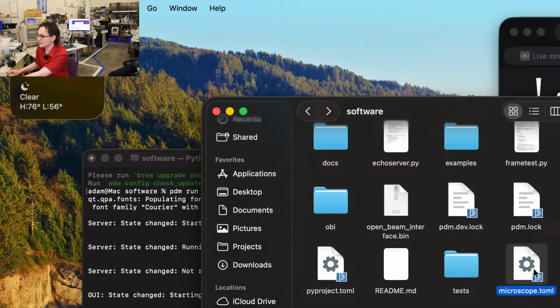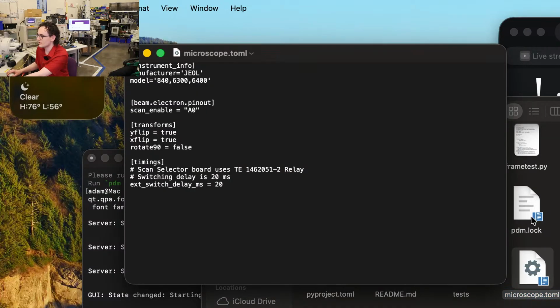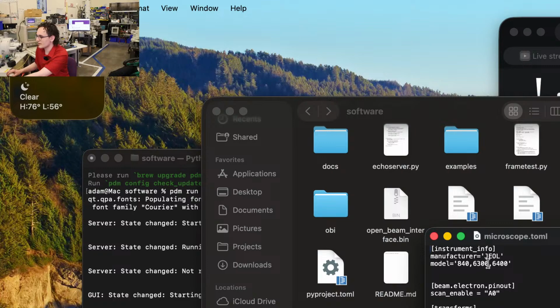And so I'll just go ahead and show you what's in our toml here. We just want to do text edit for now. So this is pretty simple. We tell it what pin we want to use for our external scan enable. In this case, we're using pin A0 on Glasgow, although for a reason we'll get to a little bit later tonight, we're not actually using that.